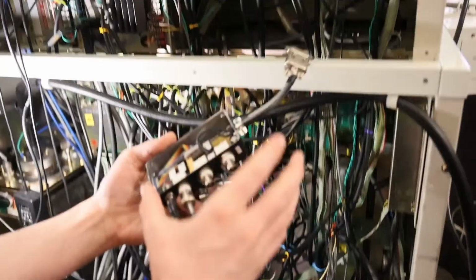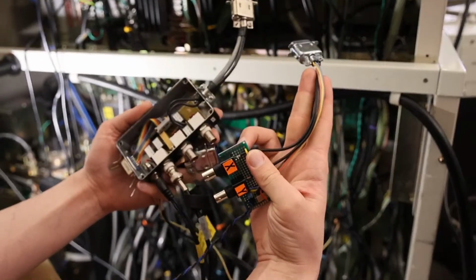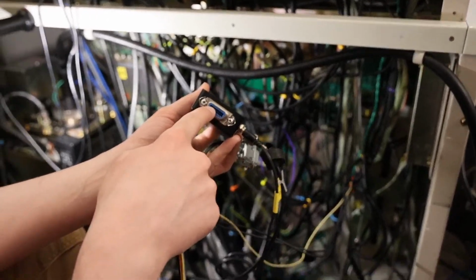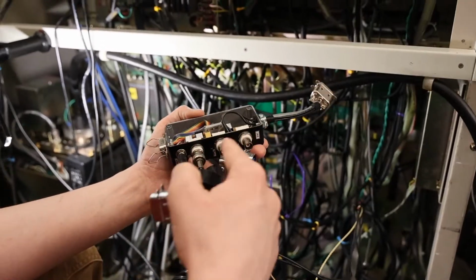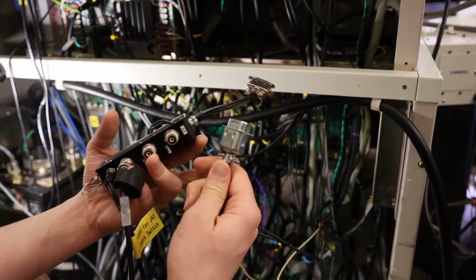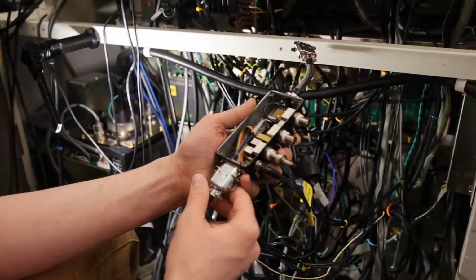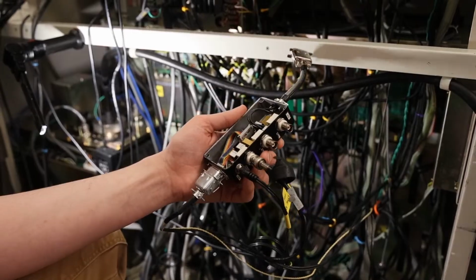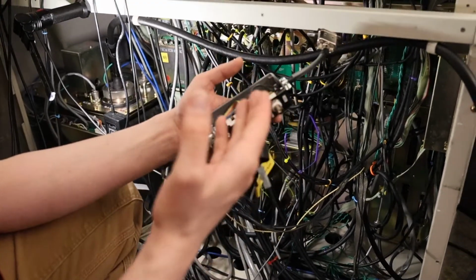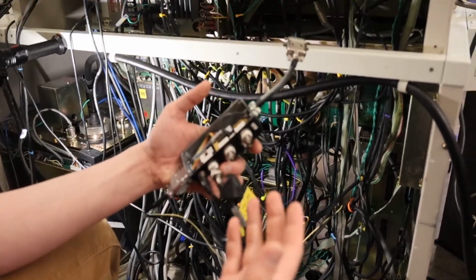And I've got this little box here. This box is very similar to what was built here, except it also has another one of the same type of connector that JA2 is, and it has BNCs. So what we can do with this is take the cable that comes from our EDS controller and plug it into here. And then once we put our open beam interface inputs in here, we'll be able to use either open beam interface or the EDS without having to come back here and unplug cables.